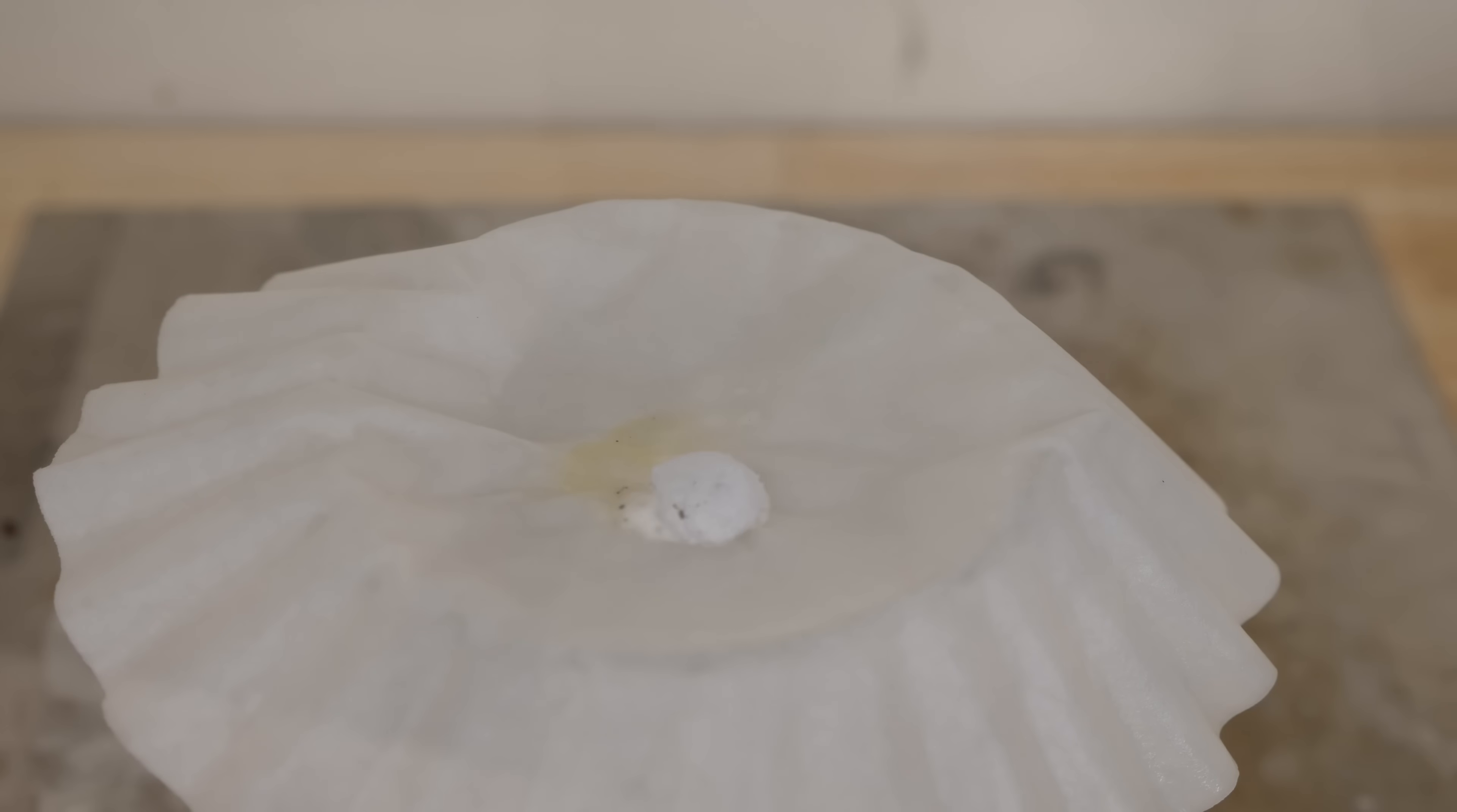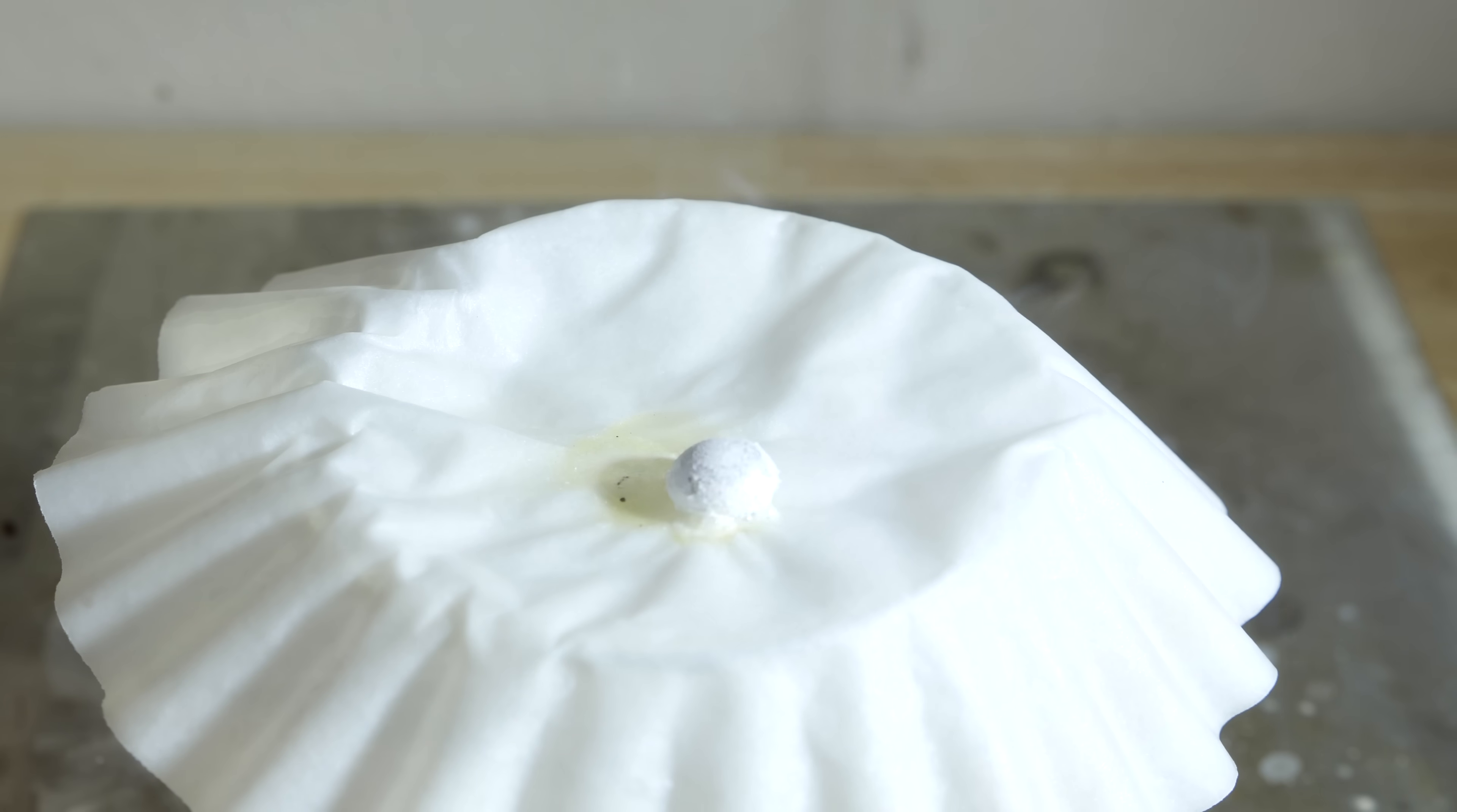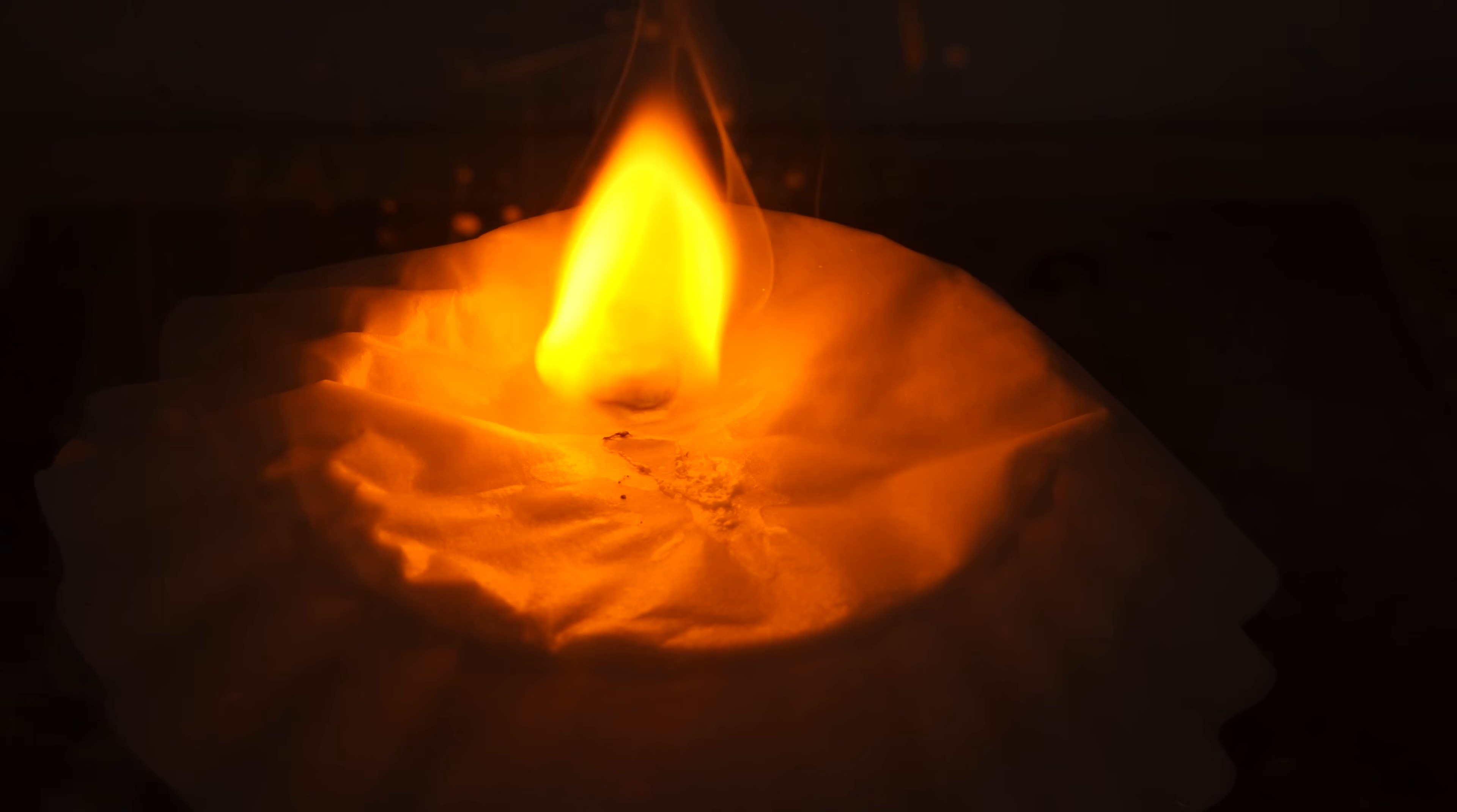So this is how it happened when I tried it with a glass beaker first. The drop just fell down into the water and exploded in my beaker. Whoa.